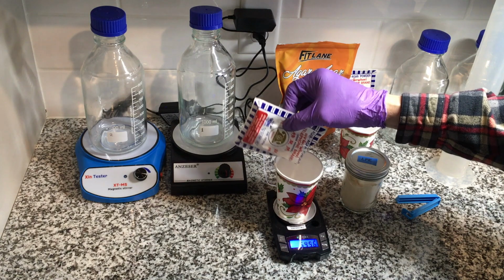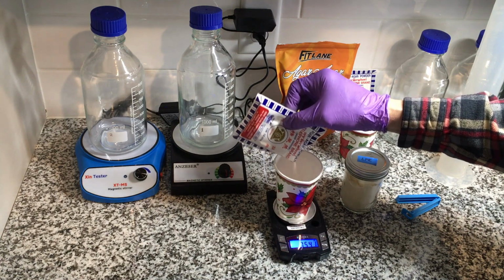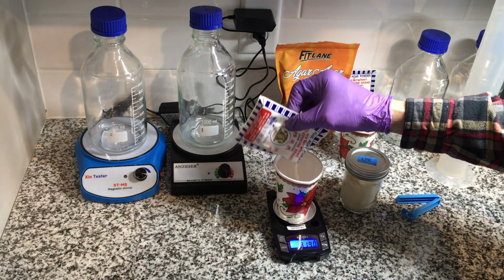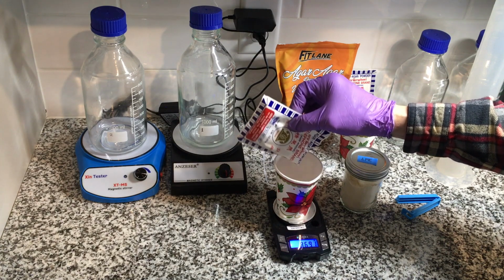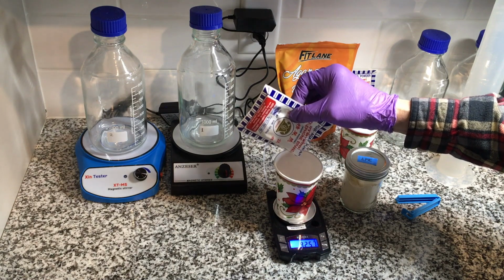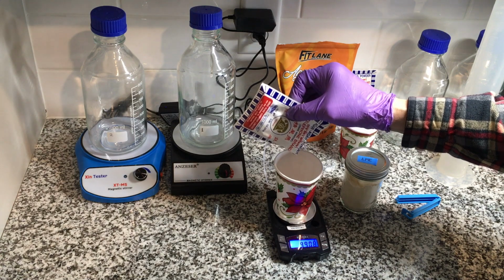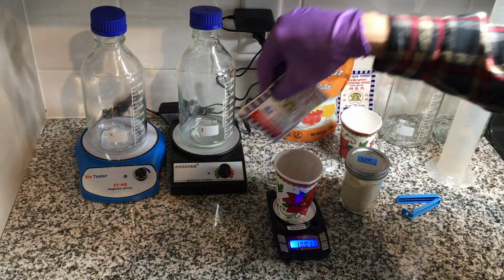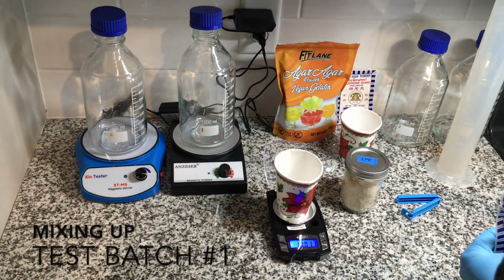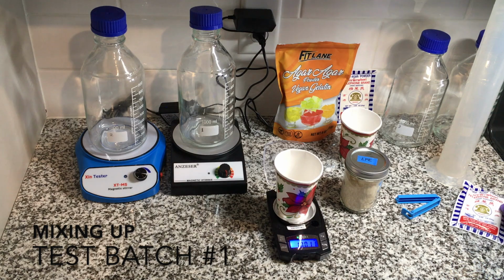And so I thought about that, and I took that sensible comment to heart. I have plenty of spare time, so I ran another side-by-side experiment to check if the TP problem was real or caused by my process. And what I'm going to show you is what I tried to document as I went along with this side-by-side, trying to keep just one variable changing in this test.